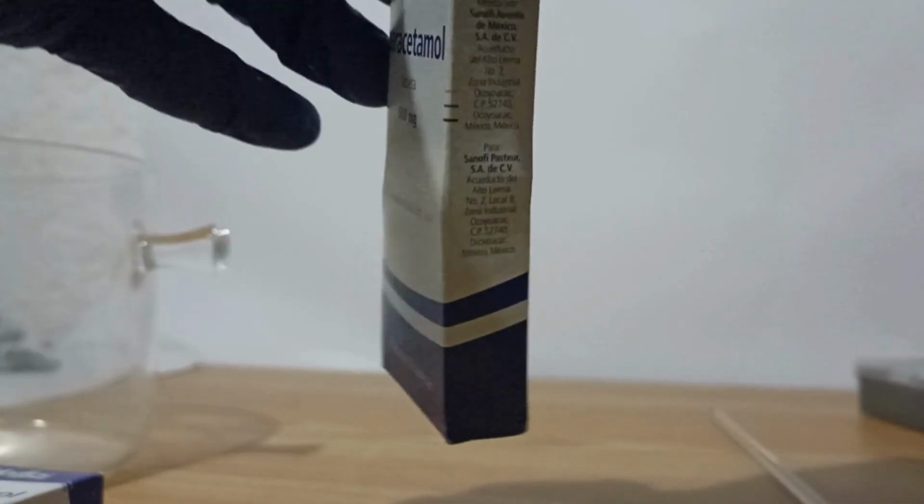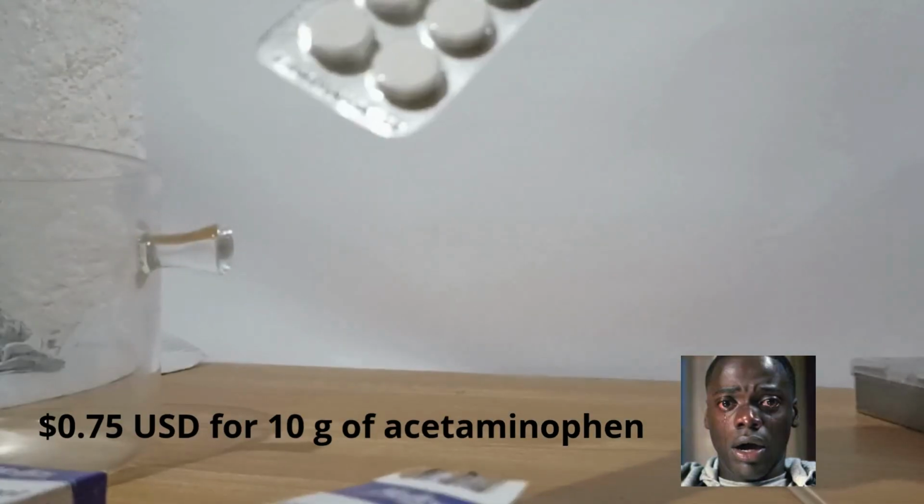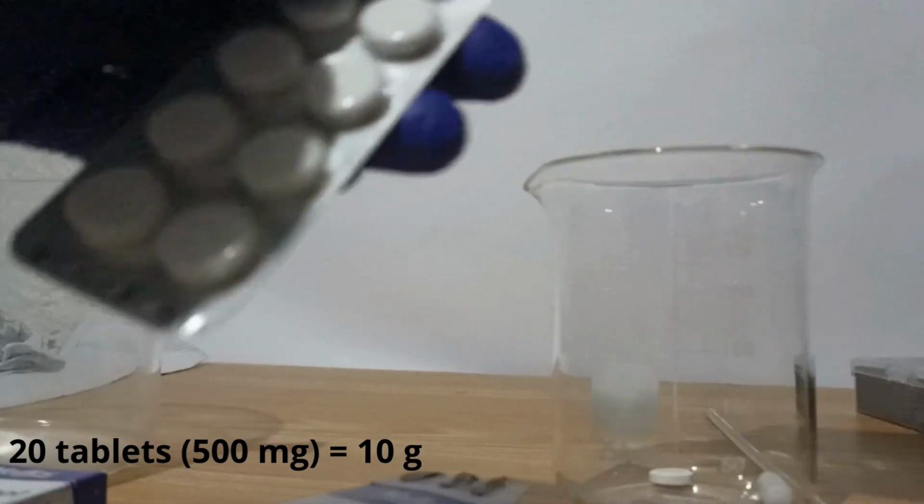It doesn't make sense how cheap paracetamol is. I got 10 grams of paracetamol for 75 cents. In total, I bought 20 tablets containing 500 milligrams each, and I started putting them in a beaker.